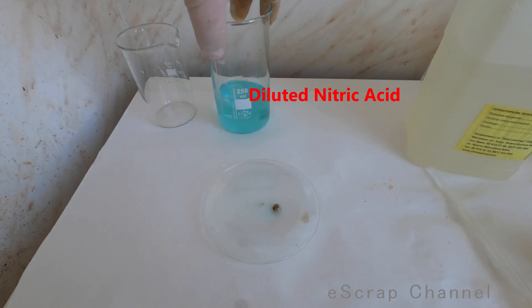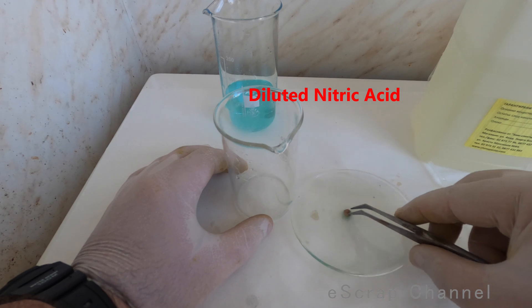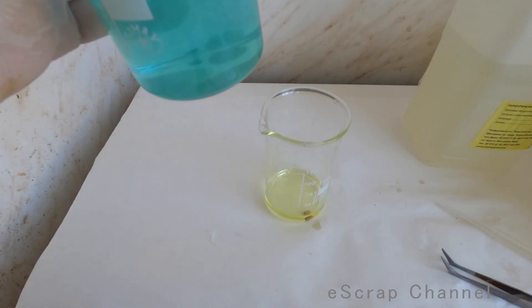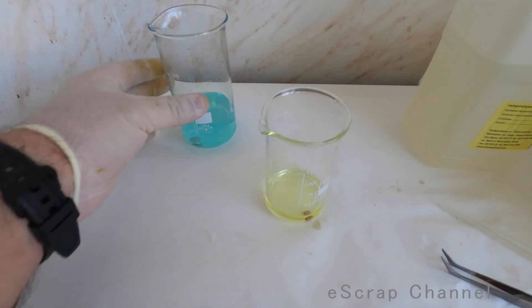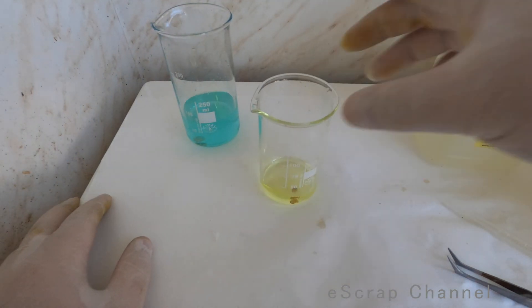So I'll just leave it like this and this small piece of gold I will purify. So what I will do - silver dissolves here in nitric acid. Gold will be slowly dissolved in aqua regia.